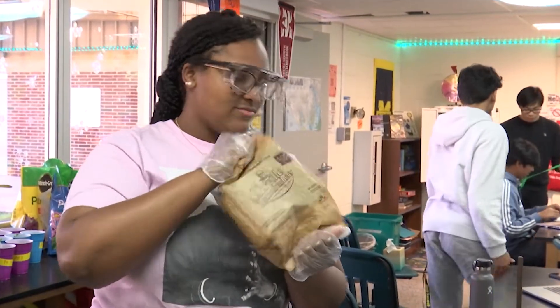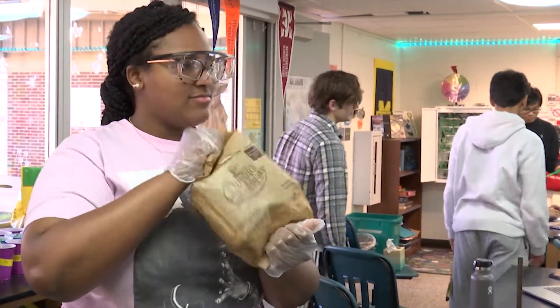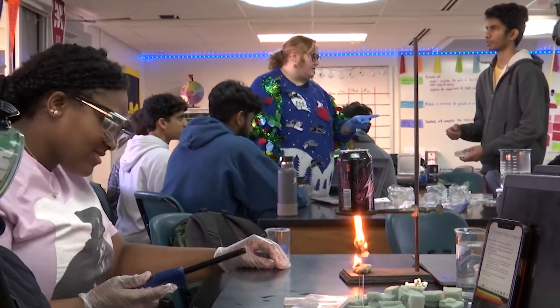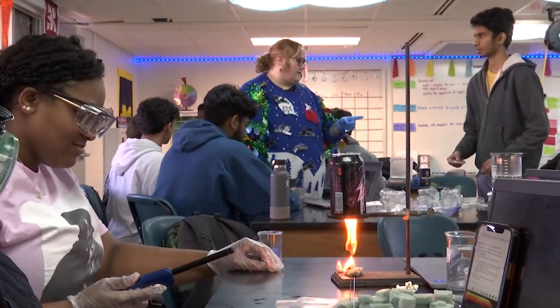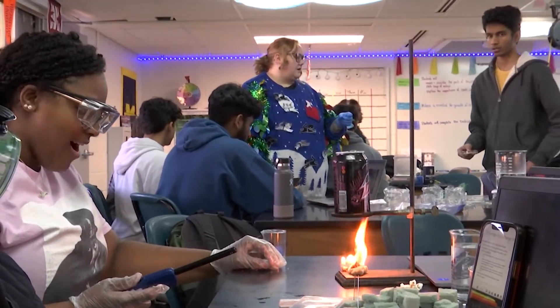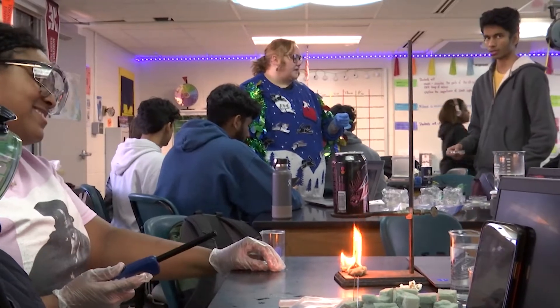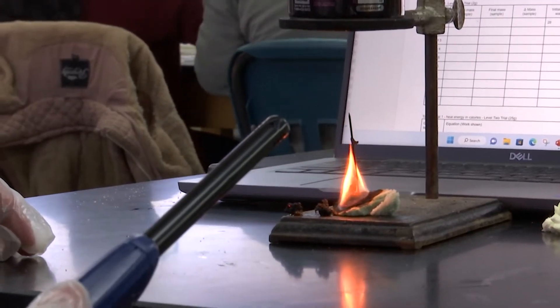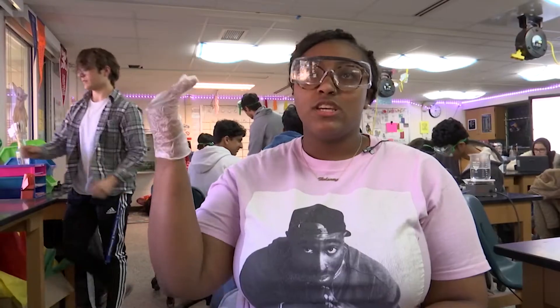Or they're doing it on popcorn and how much seasoning on popcorn is going to affect the calorimetry — the calorie content of foods. So this was two grams, and then I'm going to go up to four grams, then six grams, then eight, and then I should see a change in the calorie count after adding different amounts of popcorn seasoning.